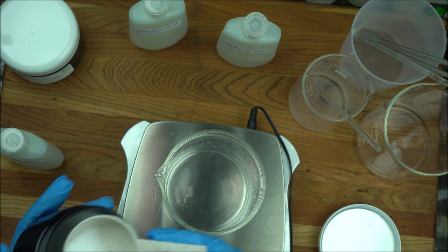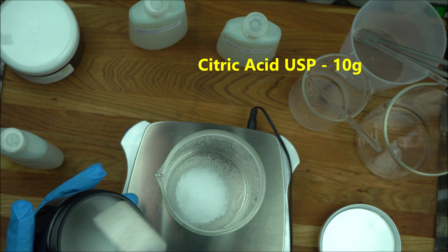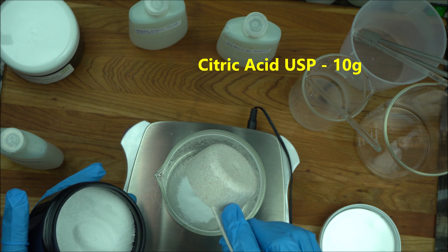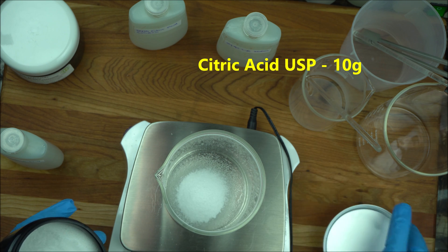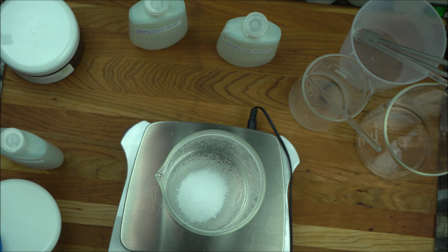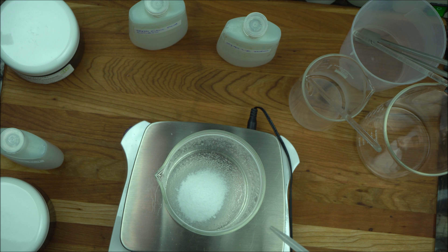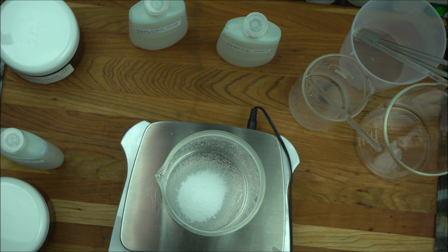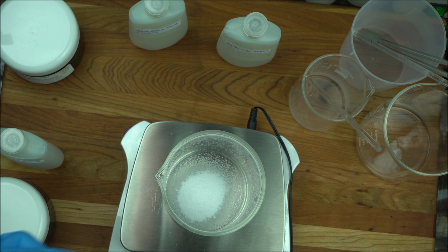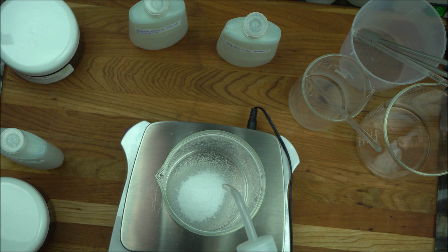The world of cosmetic formulation is very interesting if you learn it from the right source. That's why I made Stable Cosmetic Formulas available for you — you might want to take advantage of that and join me. So we have 10 grams of USP grade citric acid. It has tinier, smoother particles so it's going to dissolve faster — you can see it's already starting to dissolve. We're going to add 90 grams of distilled water to it.